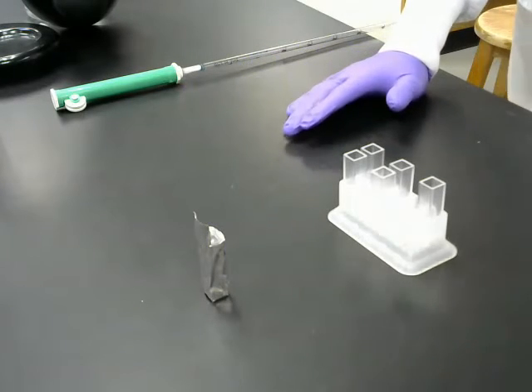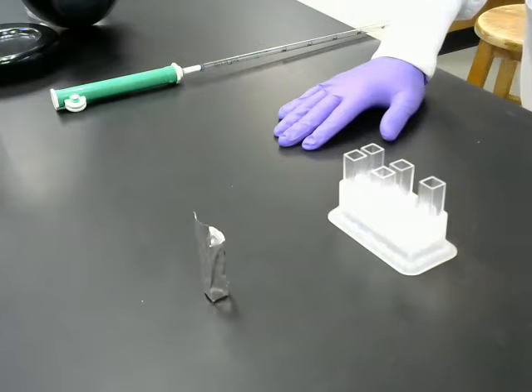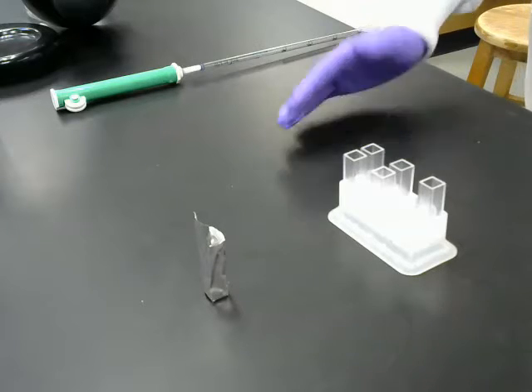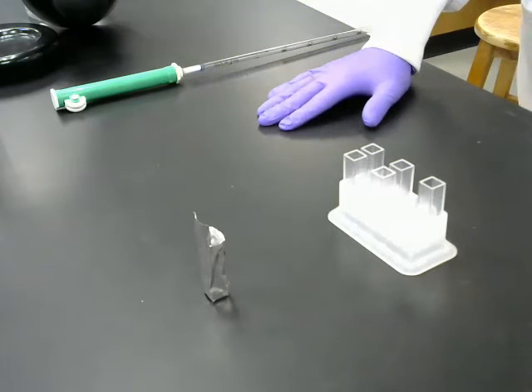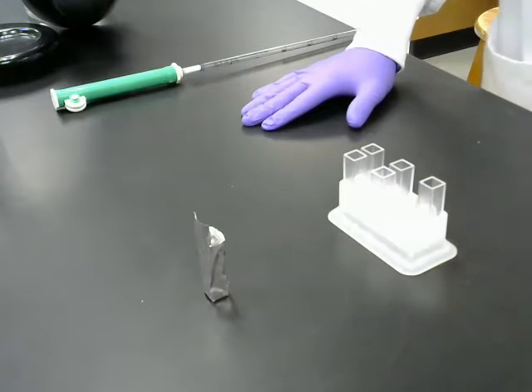So what's the function of the dark control? We know by the very name of this, the light-dependent reactions, or the Hill reactions, we know light is necessary. So why do we need to prove that light is necessary by having a dark control? Well, that's technically not really the function of this dark control.